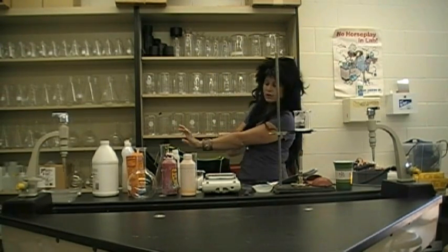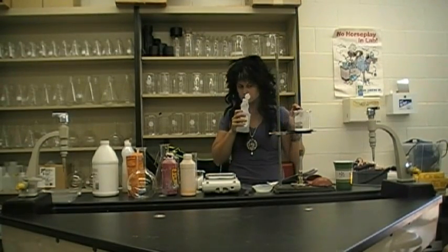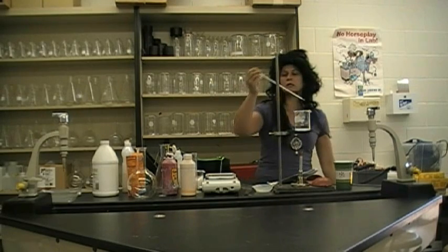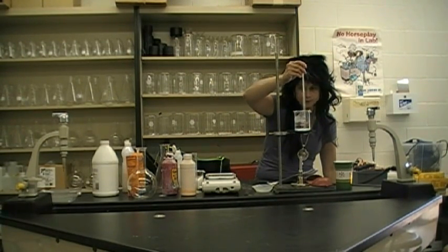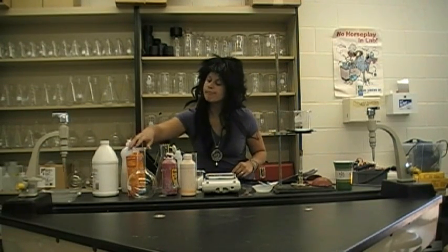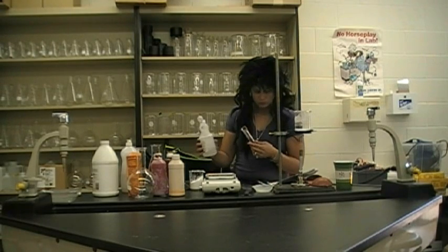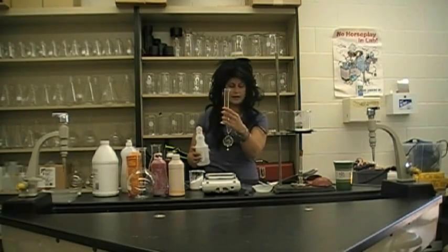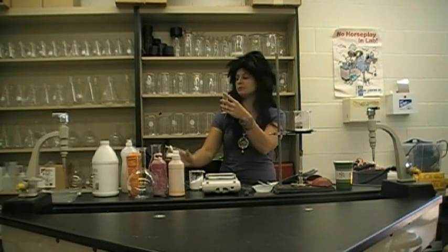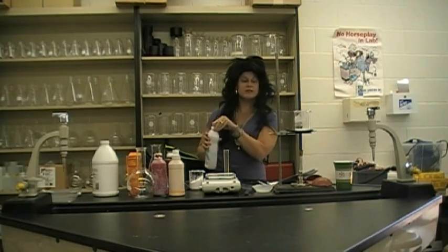What else could I do while I wait here? I don't know what this is. Let's check the temperature — still not done. That's taking so long. I think I do need this. I'll pour it at eye level. Maybe I'll just add something a little different than it says to.